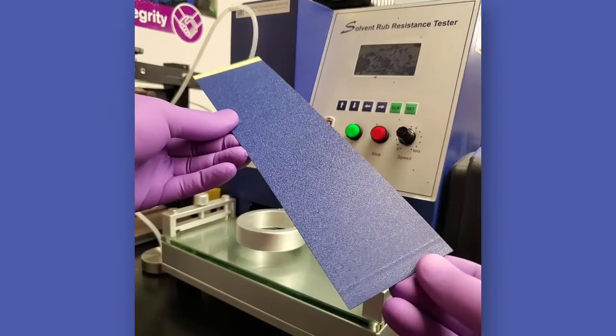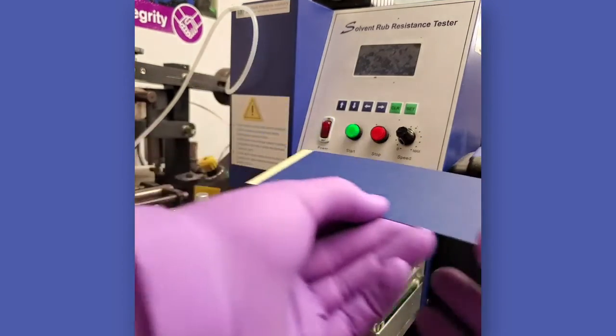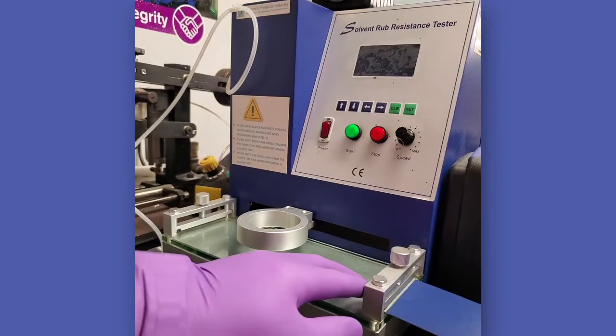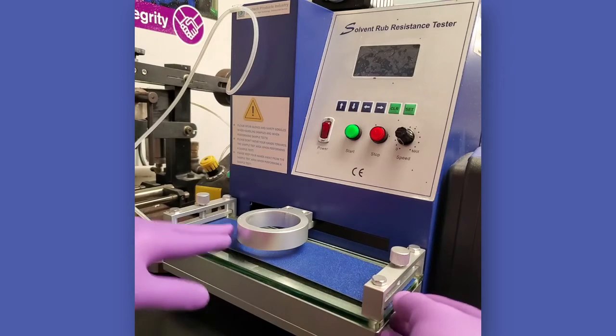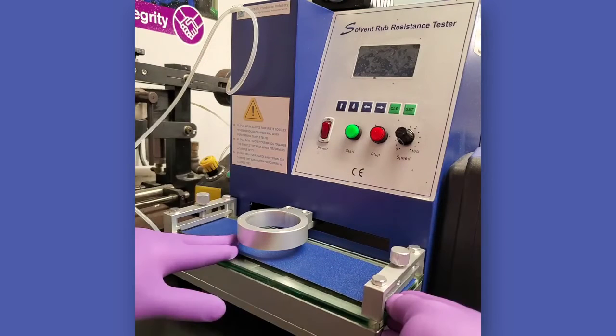The first step is to obtain a representative coated, flat panel, which has been cut to an appropriate size for the test machine. If possible, use a panel of sufficient length to allow an 8-inch long test surface with a 1-inch width. The long dimension must be parallel to the rolling or longitudinal direction of the coil for coil coatings. It is imperative that the sample be a flat surface, without any high or low points in the panel testing area, since this could result in false outcomes.